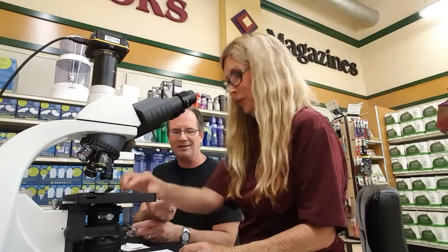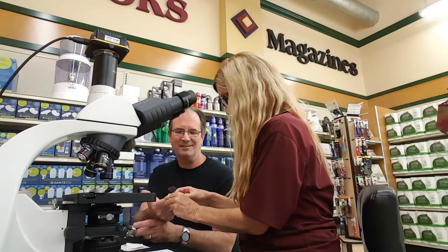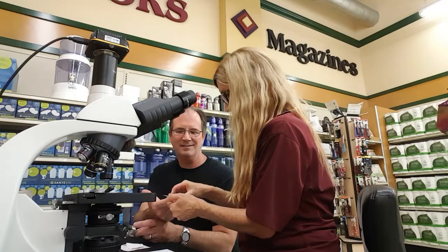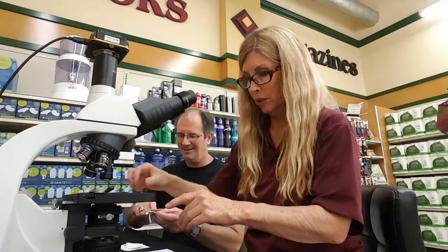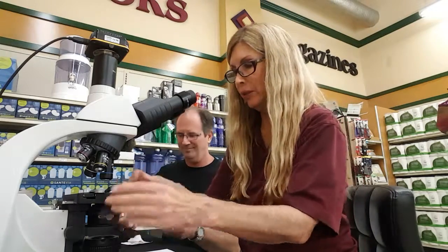Ooh, that probably stung a little bit. Look at that one. That probably stung, but I figured it gets blood this time. Okay, so go slightly like that. That's good. Now I got some blood. Yay. Alright, put it on the slide.